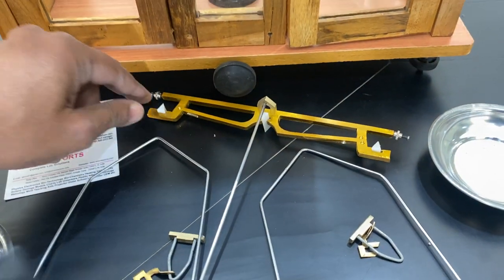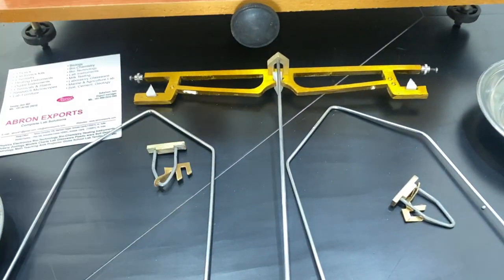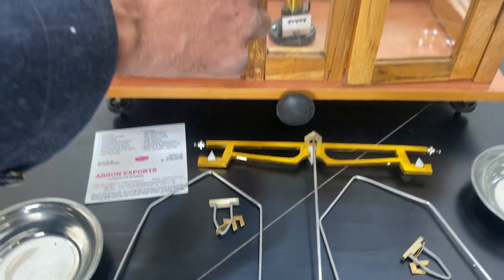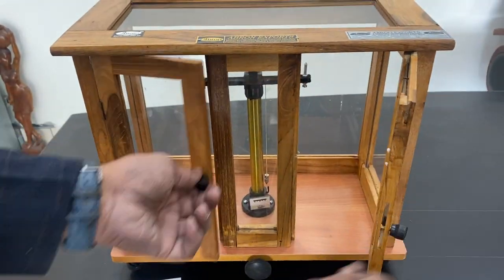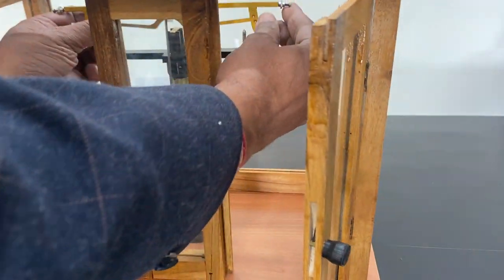Now I'll open it. Installation is very easy. Open it and put this on the beam.